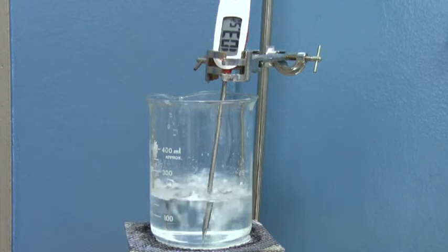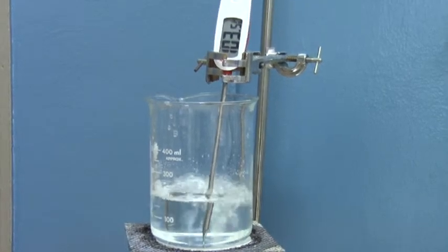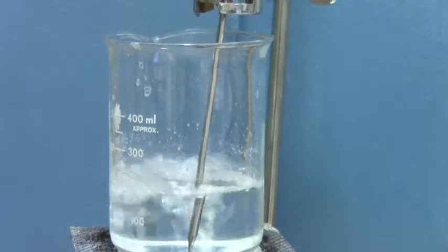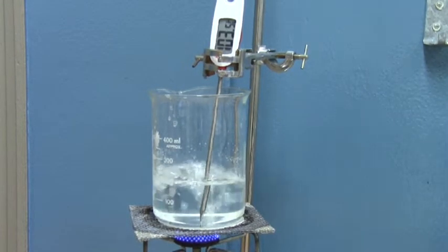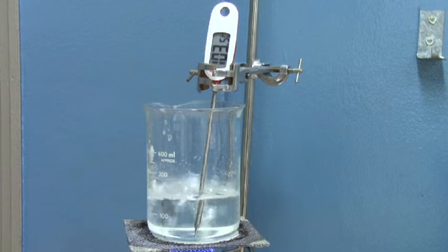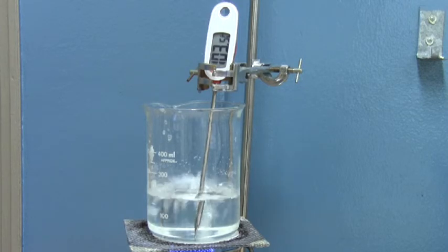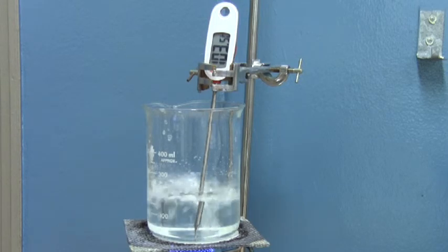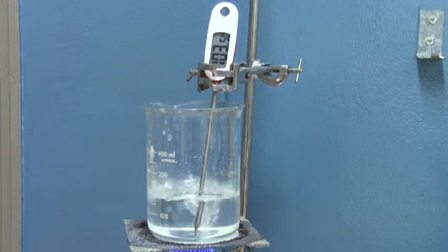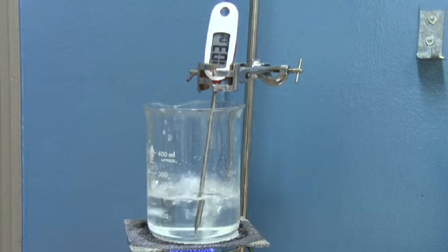You can see that adding impurities to water like salt can change the boiling point — now it is even 103.5 degrees Celsius. Notice also that the temperature is staying constant at 103.5 degrees Celsius. As more and more water boils away, the boiling point will probably increase as the salt becomes more concentrated in the remaining water, because the salt does not evaporate. The three teaspoons of salt are still in the water, and as you lose more water with the same amount of salt, the concentration will increase and the boiling point will go up.